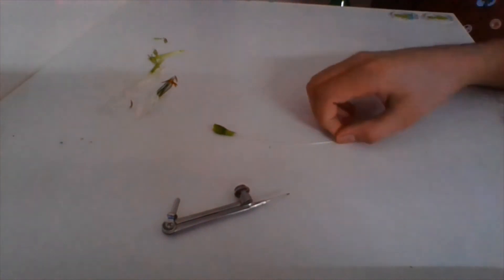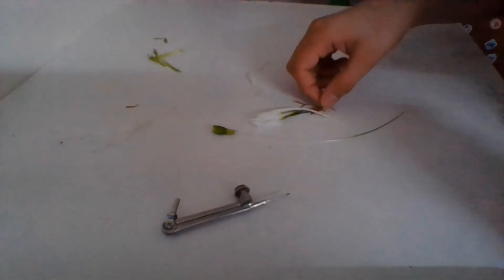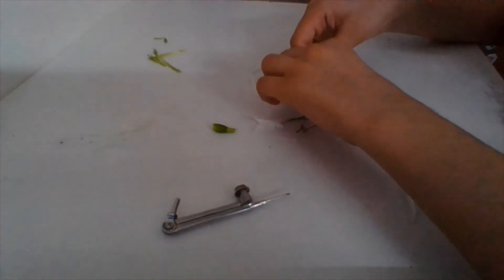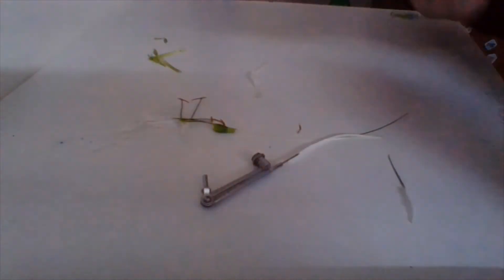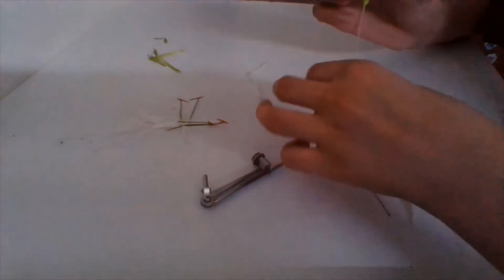Quick recap: this is one petal, and all petals together are known as the corolla. This is the filament, the top part is called the anther. One filament plus one anther is called a stamen, and all stamens together are known as the androecium. In the female parts, the top part is the stigma, the long thin part is the style, and the bottom part is the ovary. Thank you.